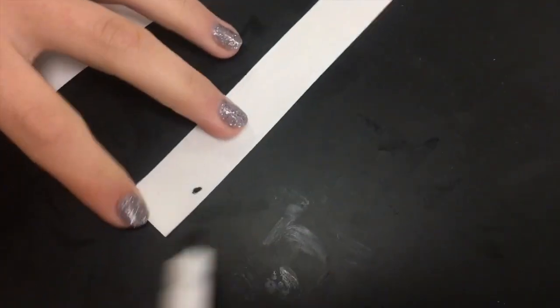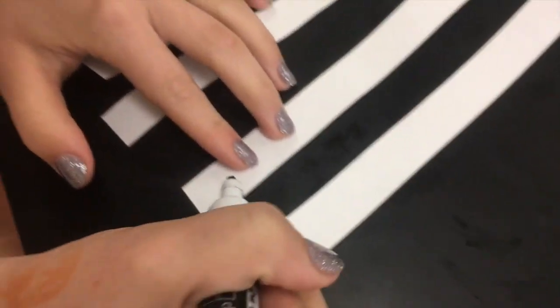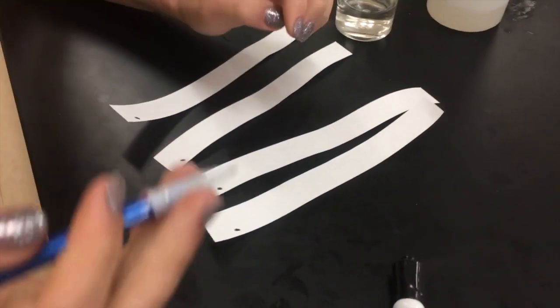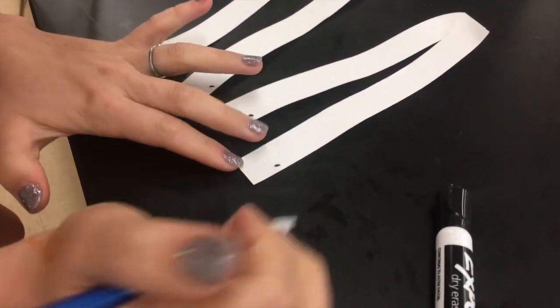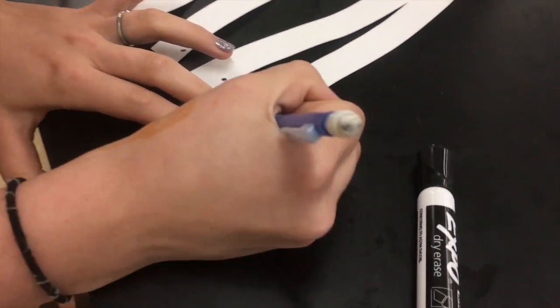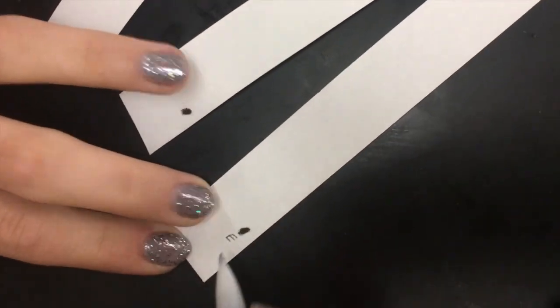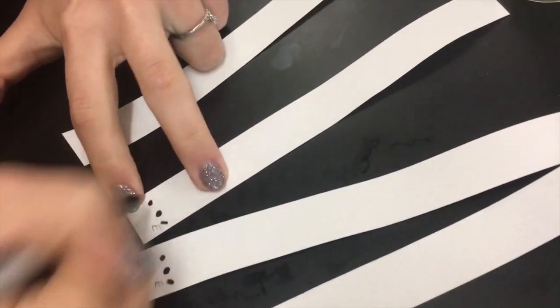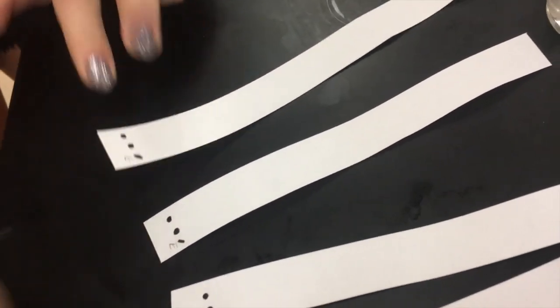Now use each marker to place a small dot at the bottom of every strip. So you'll have three dots per strip. After each mark, you want to make sure you know which one is which. We'll put an E for Expo. You do the exact same for all three of them.